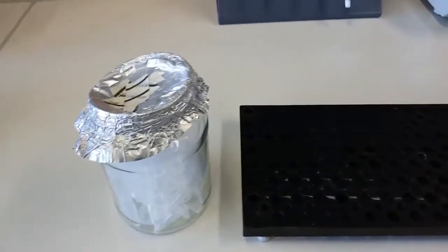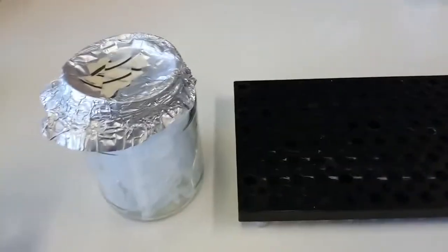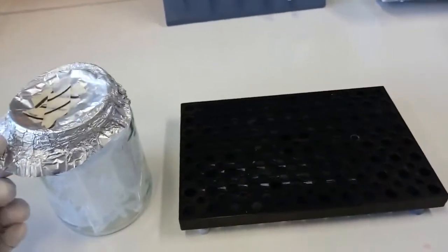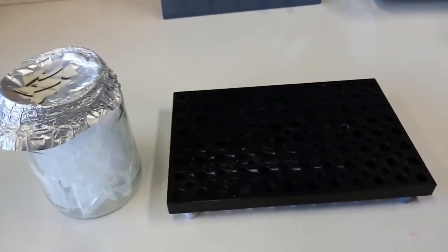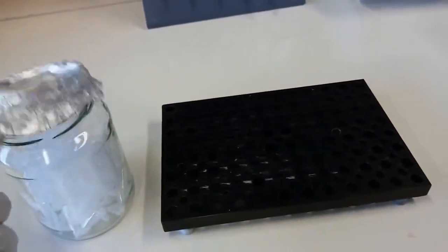They are closed with aluminum foil because we use them after sterilization. So we sterilize them using an autoclave. I will tell you about the autoclave in detail. This tutorial is just to make you familiar with the different terms that are common and that you should know.